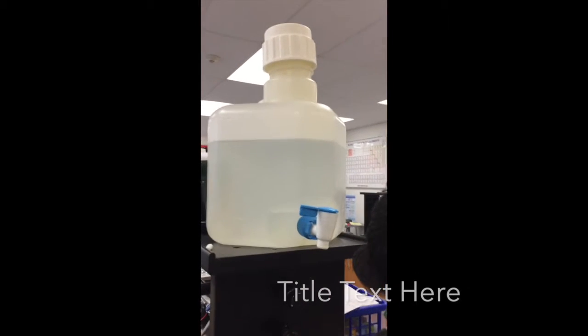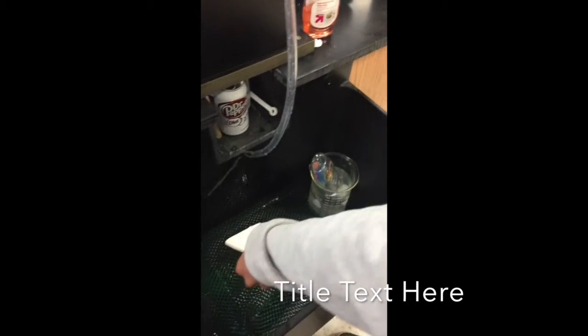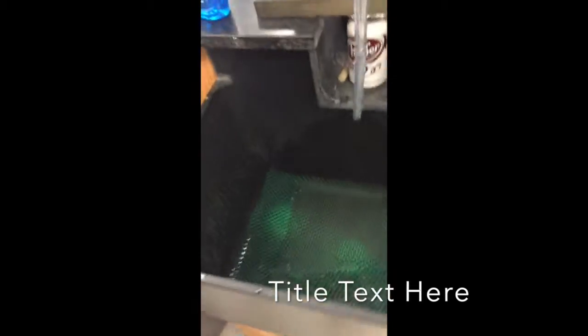Disposal methods. After we finish the test, we clean up. We put the burnt Q-tips from the flame test in a big beaker. This was crucial in order to avoid any fires starting by putting them in a giant trash can. We made sure that our hands were dry before we pulled the plug of the Bunsen burner that was used in the flame test.